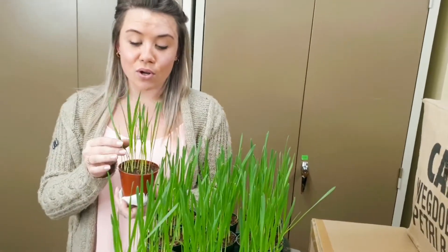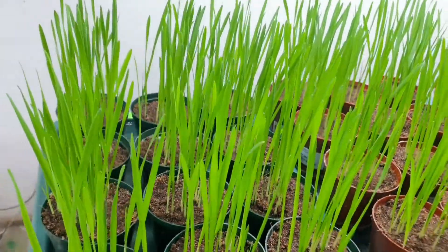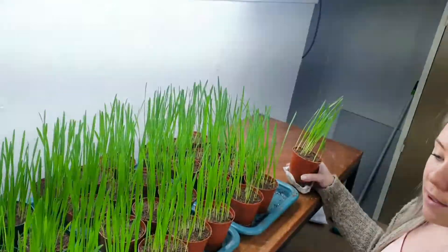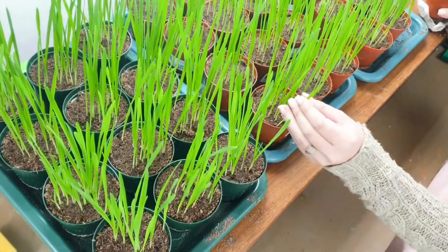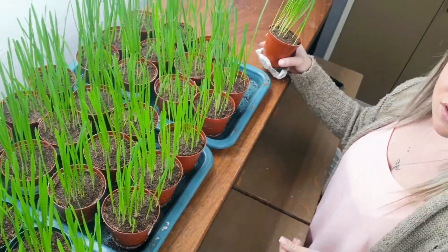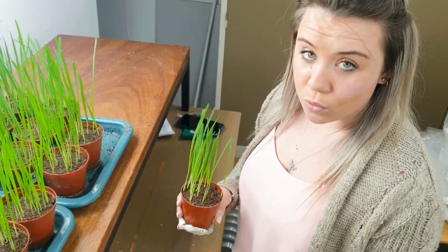Oats are very nutritional and I would suggest growing your own — they're really not finicky. They grow very well; just look after them and treat them well. The plants are very healthy. I water them twice a week every Monday and Friday and put them in a good lighted area. Oats are actually very sturdy plants — they don't struggle and they don't die quickly.